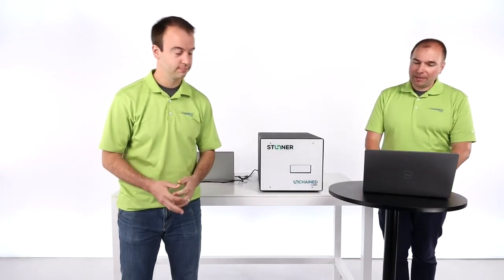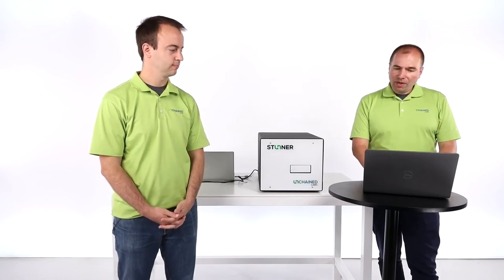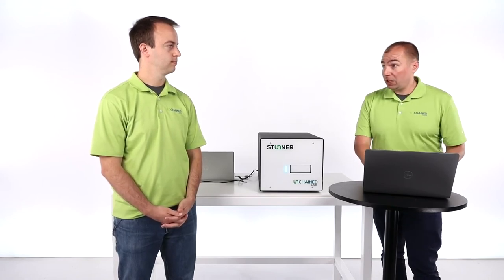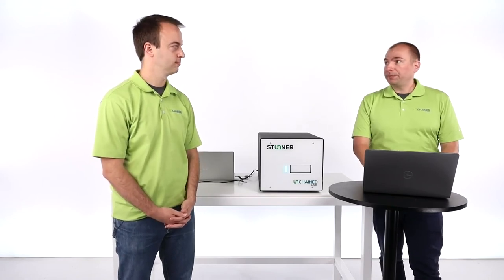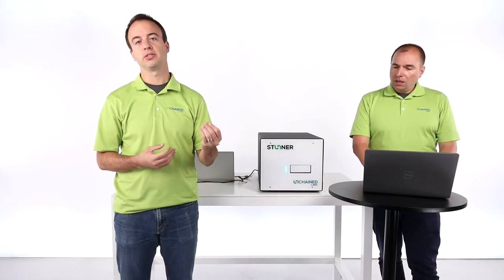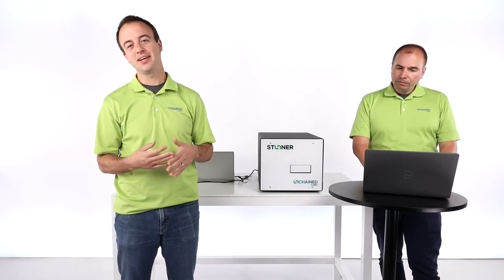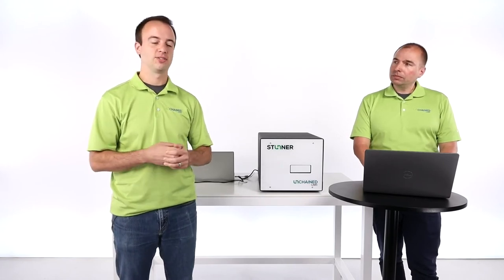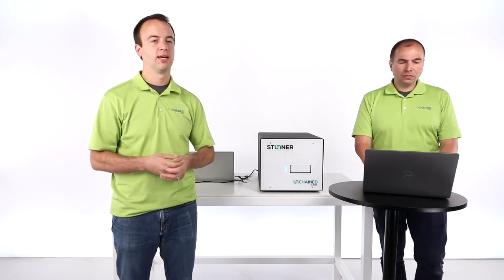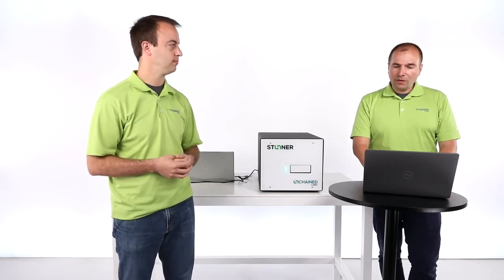Thank you very much, Kevin, for this great demo. We have a number of questions that have come in already. First, a question on the practical nature of things - what sample prep do you need to do before a Stunner run? So the short answer is exactly what you saw today. Usually you can just run your AAV with exactly the sample that you have. You don't need standards, you don't need reagents, you don't need dyes. It's working off of UV-Vis and light scattering methods, calculating from first principles - a standard-free approach to characterizing.